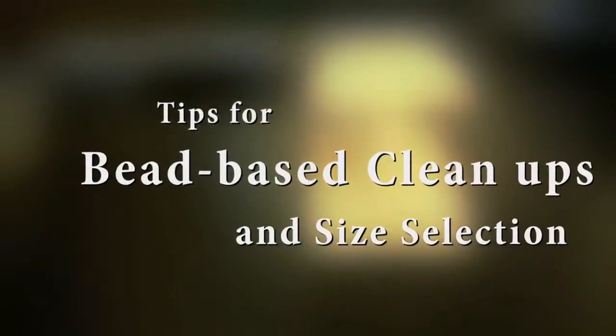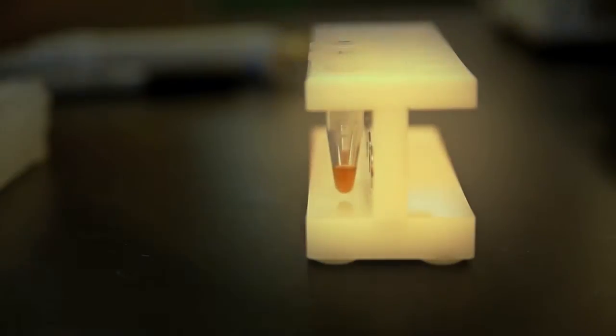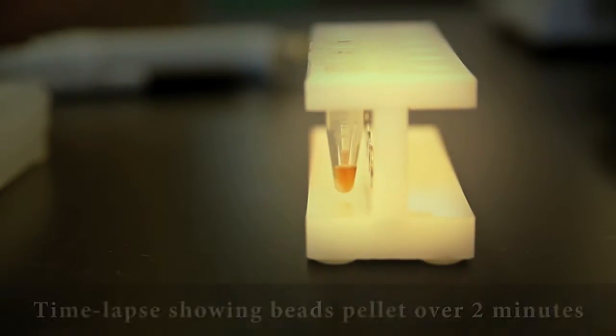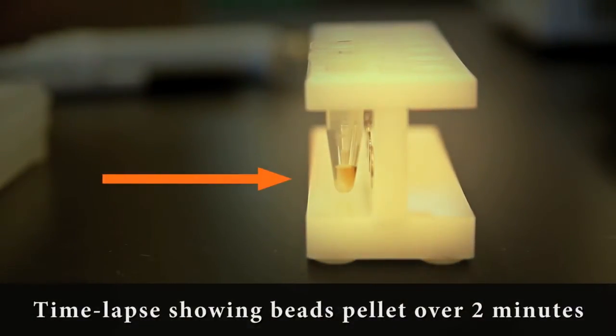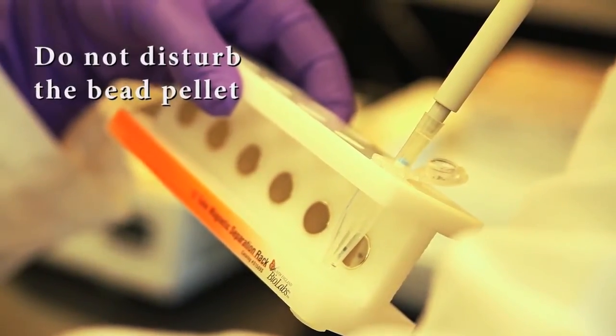Here are some tips if you're using bead-based cleanups and size selection. Be sure to let your beads fully pellet next to the magnet. This should take a couple of minutes as shown in this time-lapse video. Be careful when transferring material not to disturb the bead pellet.